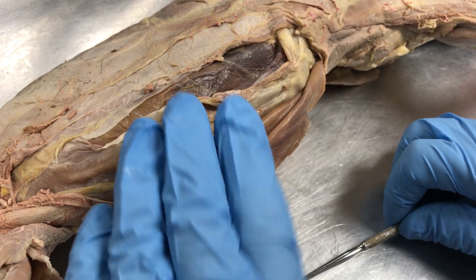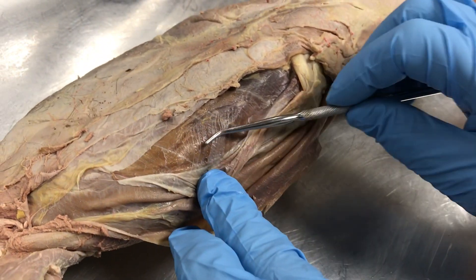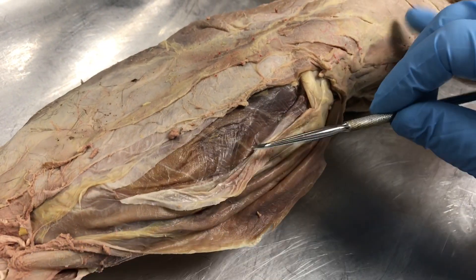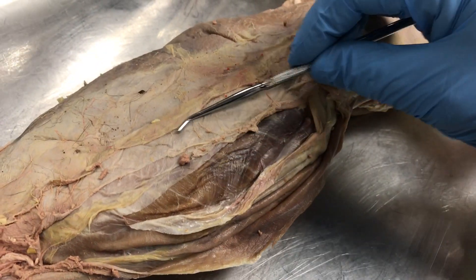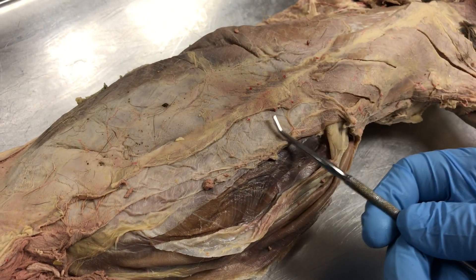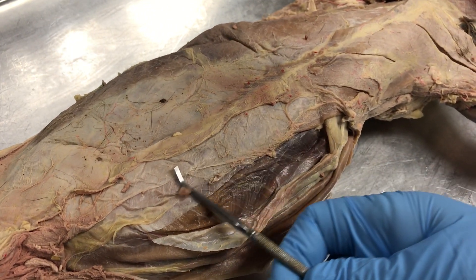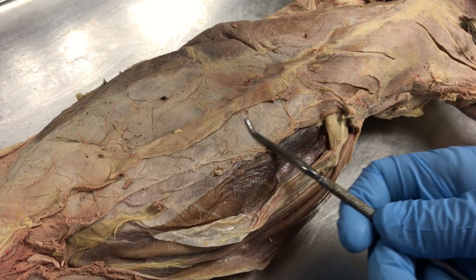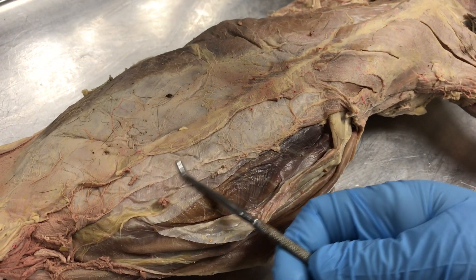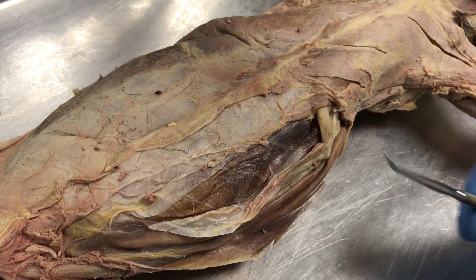You can see how the fibers are going in a totally different direction, and then the transverse abdominus, which takes us over to the linea alba. There is a rectus abdominis, which doesn't seem to show up very well in this cat, which would be right here. So we've got one muscle that we just are not going to be able to show very well.